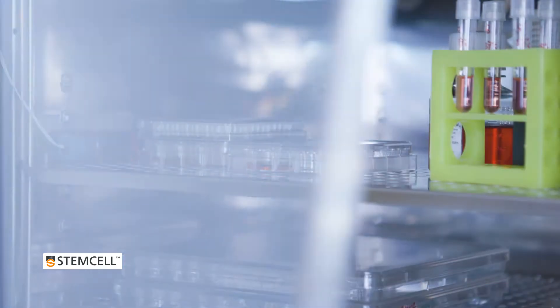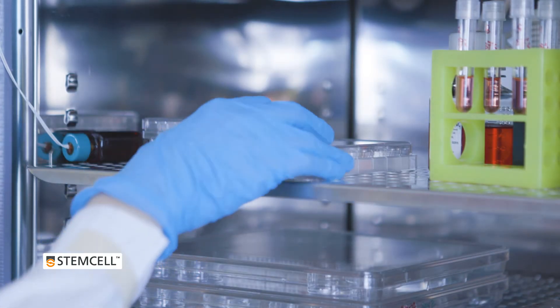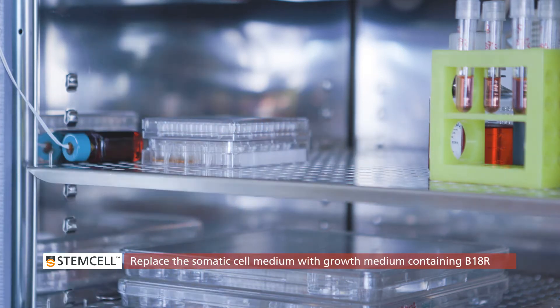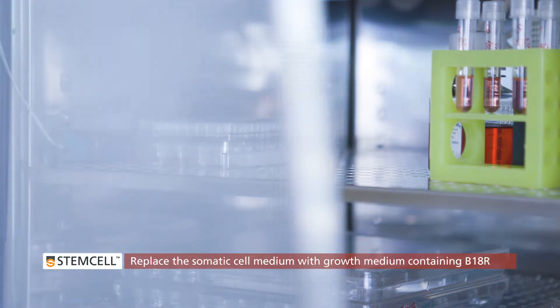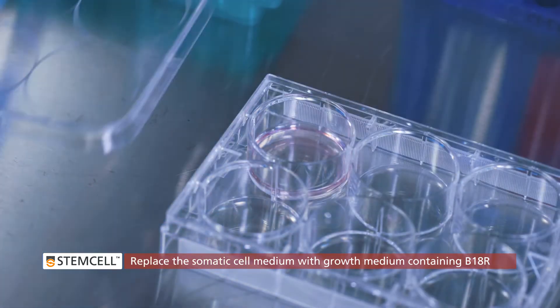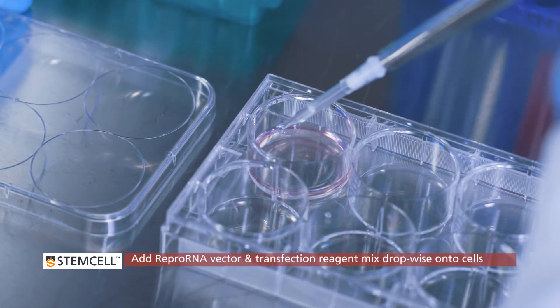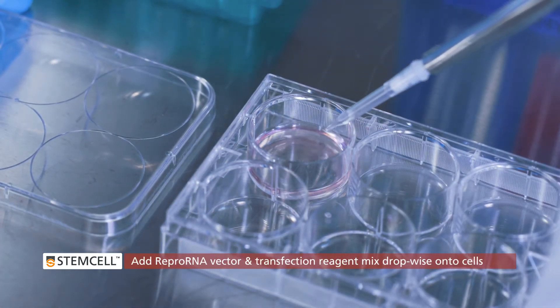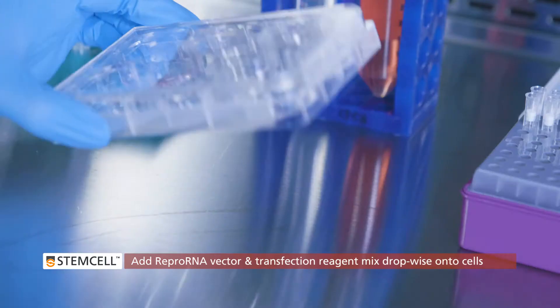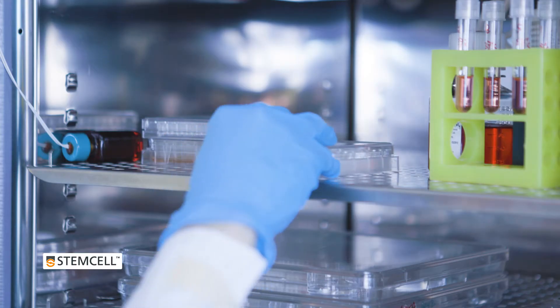Take your previously plated somatic cells on a Matrigel or Vitronectin XF coated plate and replace the somatic cell medium with growth medium containing B18R. Add the ReproRNA vector and transfection reagent mix dropwise onto the cells. Gently rock the plate for even distribution.